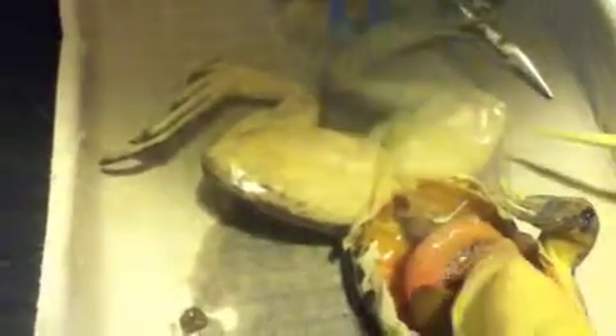What else we got in there? I see the fatty bodies, look. You see them? Yes. And there's the stomach. And under there, is that the pancreas? Yes. I think that's a kidney. Oh. Yeah, those are kidneys.